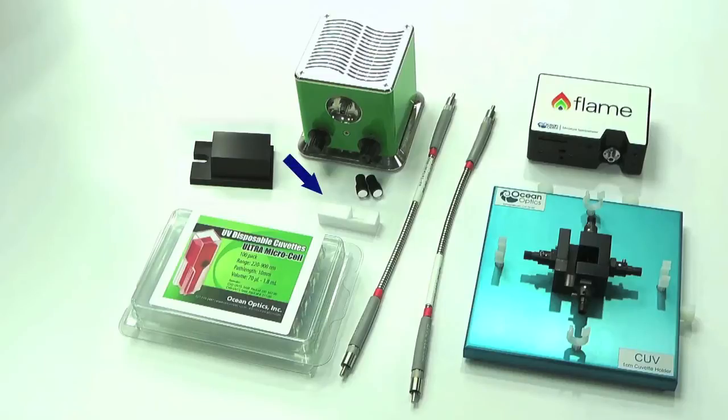A diffuse reflectance standard for use as a reference when taking fluorescent measurements, and finally, two mirrored screw plugs that can be attached to the cuvette holder to maximize the amount of fluorescent signal reaching your spectrometer.